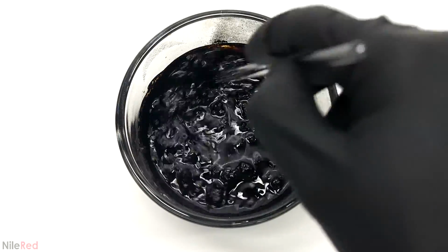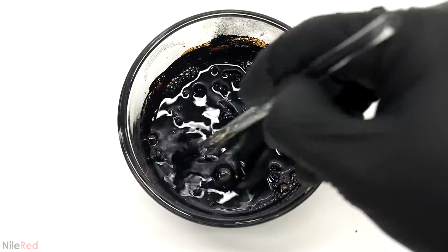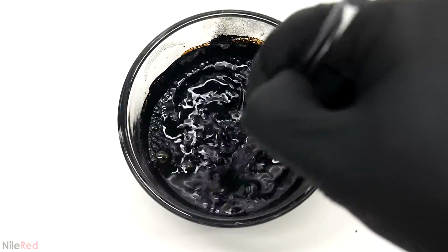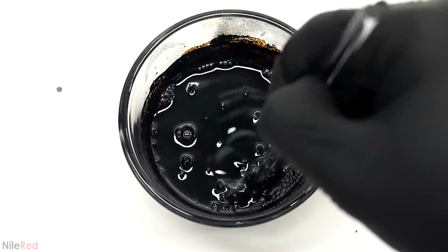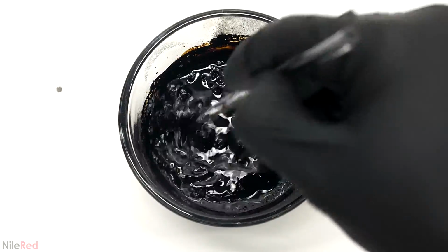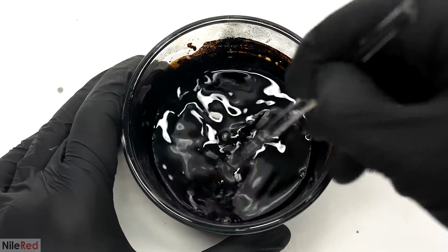The result of this is a stable suspension known as a colloid, where it's almost like the magnetite is being dissolved. Even after mixing it for a few minutes though, there was still quite a bit left. Sometimes it didn't really even look like much was happening, but it's just genuinely a really slow process. To speed it up, I could have just added more kerosene, but my goal here was to get it as concentrated as possible.